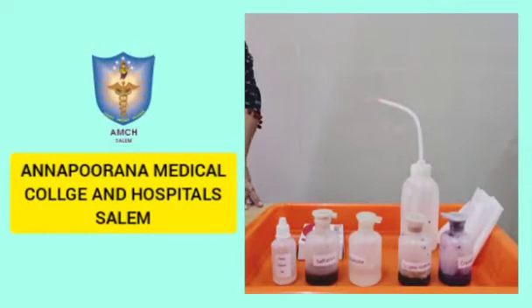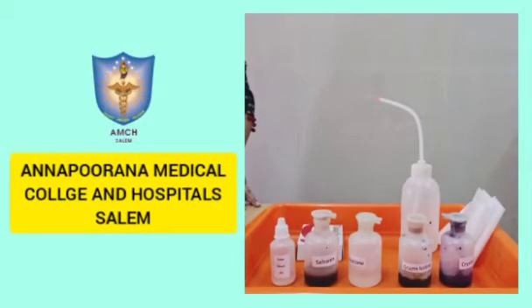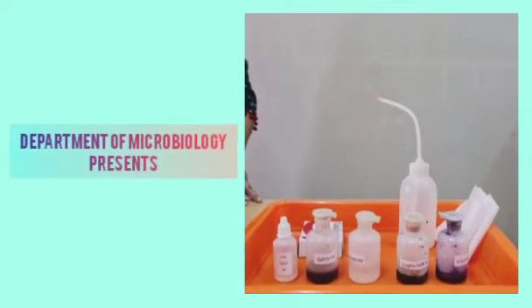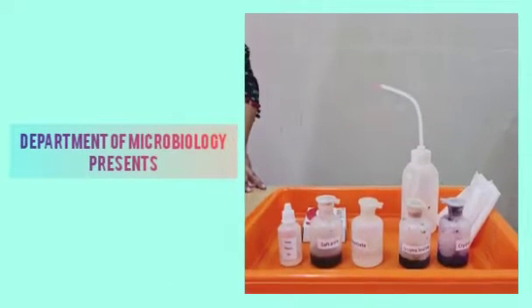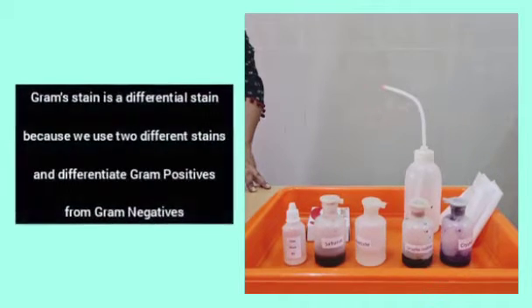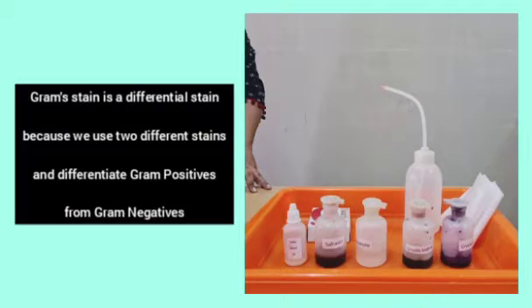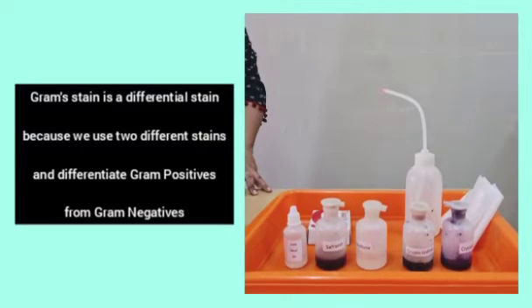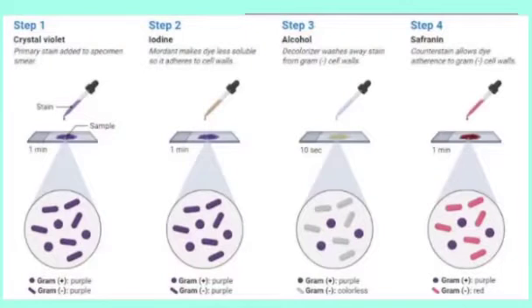Good morning students. This video is about the procedure of gram stain. We will demonstrate step by step how to do a gram stain and interpret a gram stain smear. Gram stain is a differential stain because we use two different stains and differentiate gram positive bacteria from gram negative bacteria.